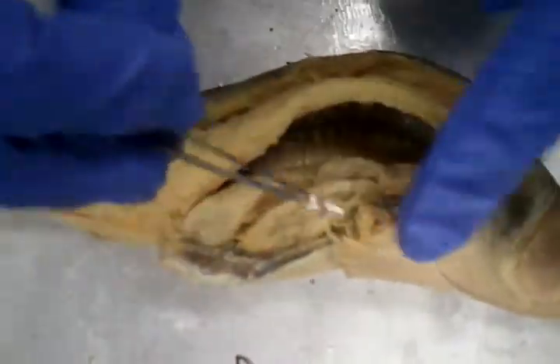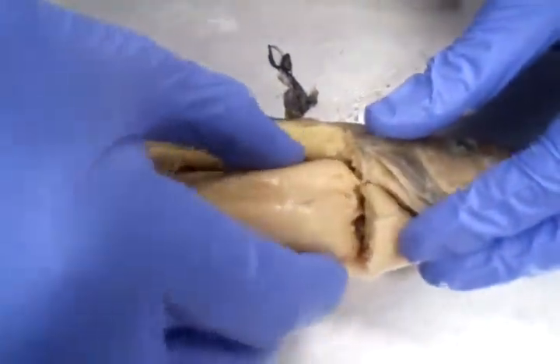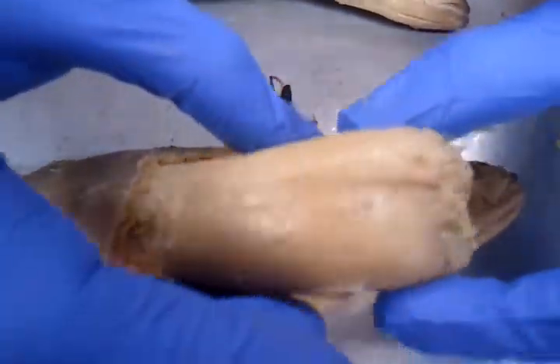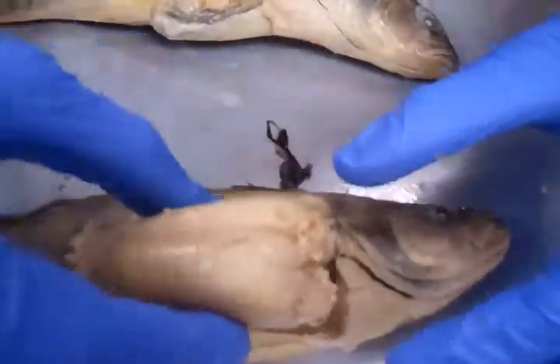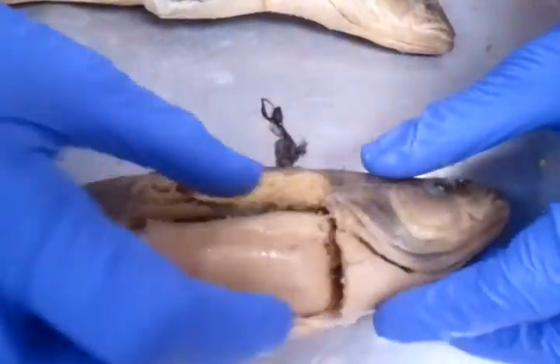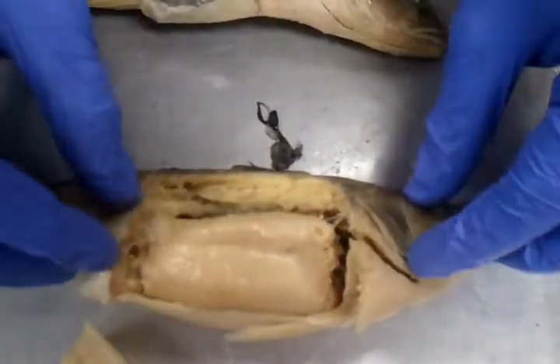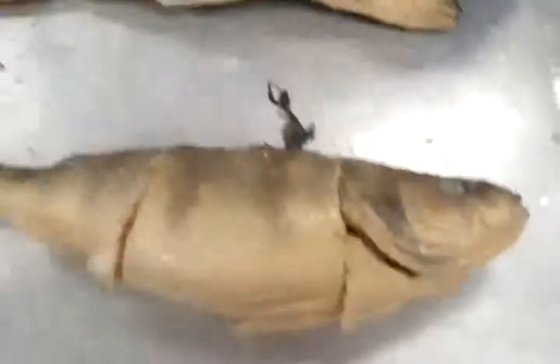Now, the important thing about this next fish, let's go ahead and move down. This fish is currently housing thousands and thousands of eggs. Look how big this gonad has to be in order to contain this. Obviously, the fish is weighed down from having all these eggs, so it is at a bit of a disadvantage, but nonetheless, a very amazing dissection with all these little eggs. Can you see the individuals here, just like that? All right, very good.